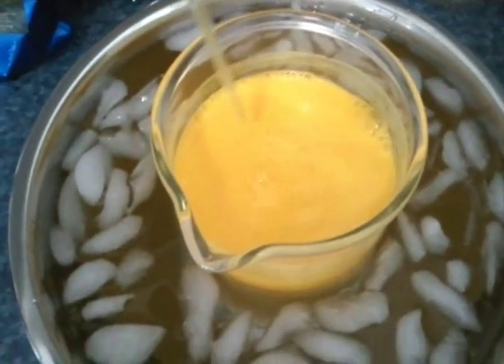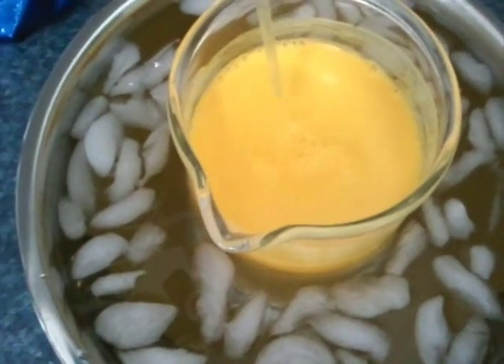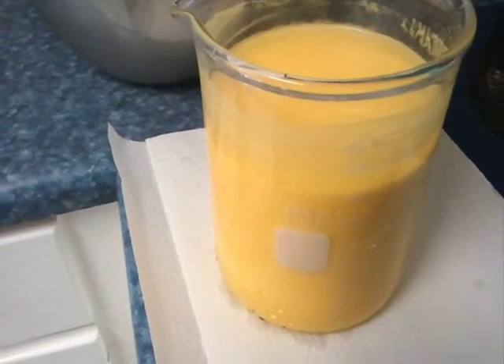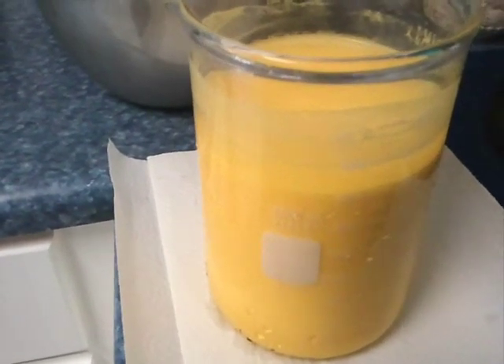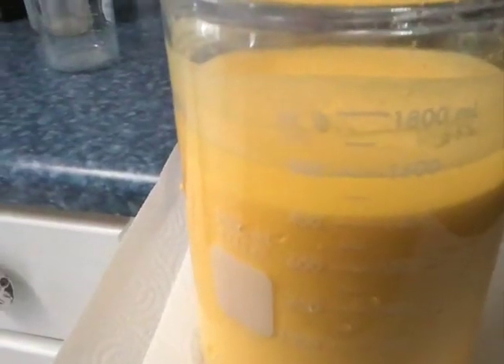You can wash this yellow salt off your glass rod back into the reaction beaker with just a regular water squirt bottle. I have pulled the solution that is precipitating out of the ice bath just so you can see how the colored powder looks and also how the solution looks as the powder settles out of it.